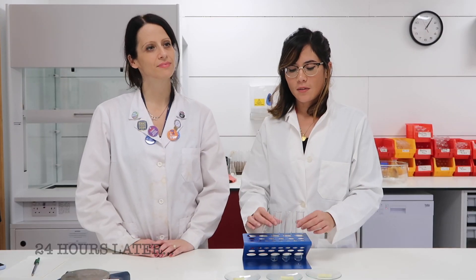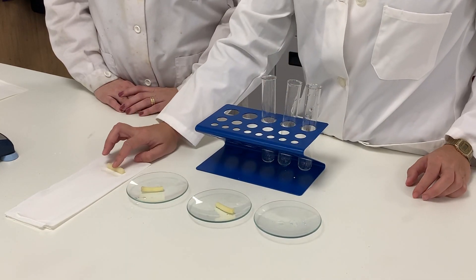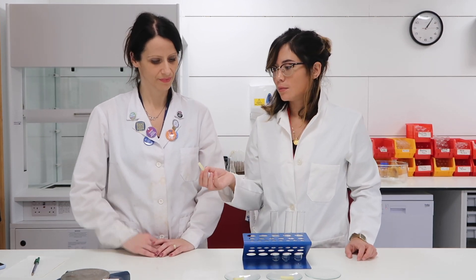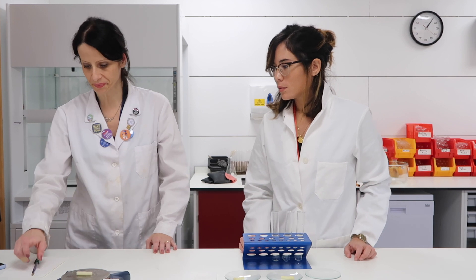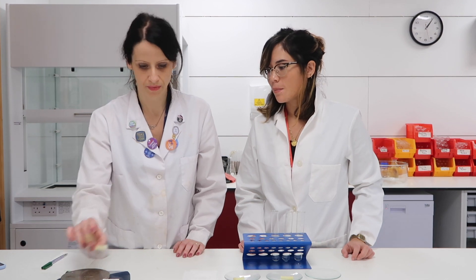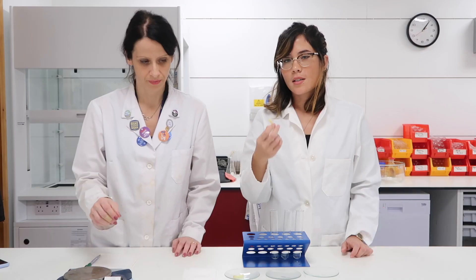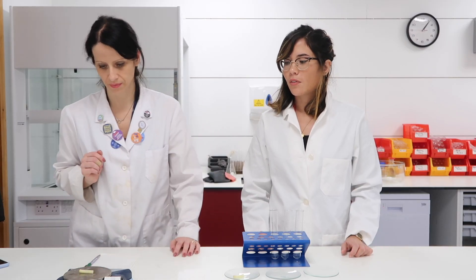Fast forward 24 hours. We've drained our three potato chips and they're now sitting on the watch glass. We're going to dry them carefully using some normal kitchen paper in order to remove any excess water so that they can be weighed accurately. This potato chip was placed in pure water — it's 2.17 grams. Our starting mass was 2.14 grams, so our change in mass is 0.03 grams. Our second chip — blotting it dry — was placed in 0.5 molar sodium chloride, salt solution.